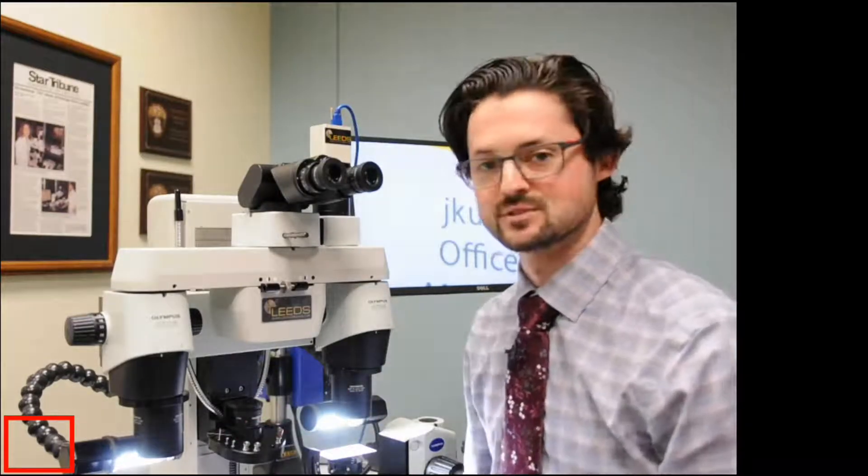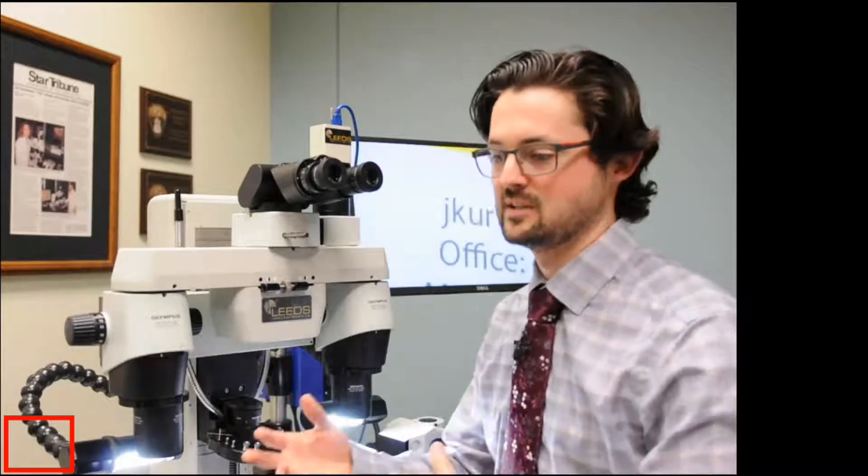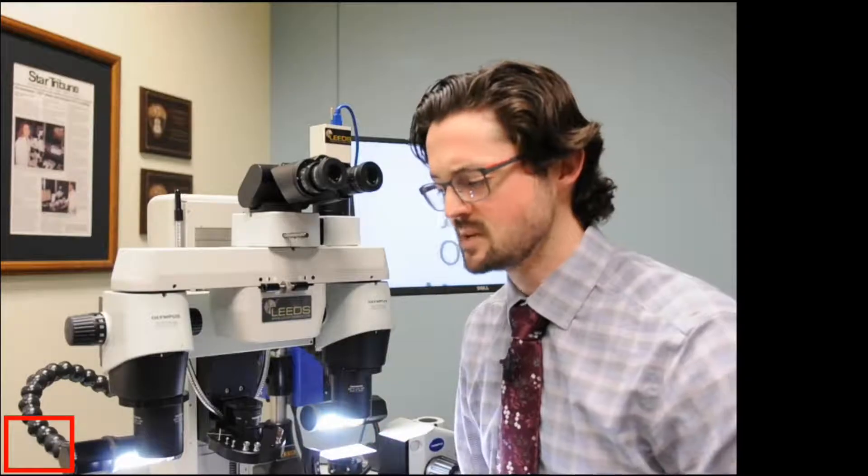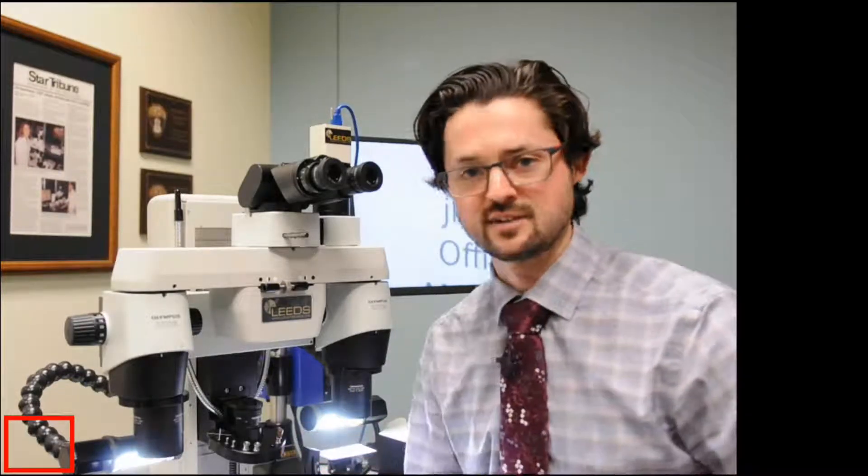So getting those diopter numbers, dialing them in and knowing them can be really helpful if you're moving on microscopes and moving off.